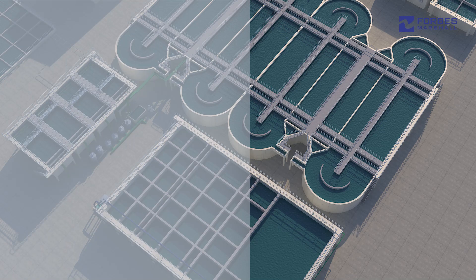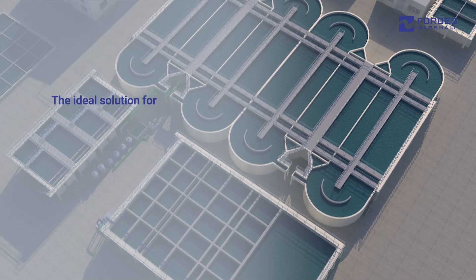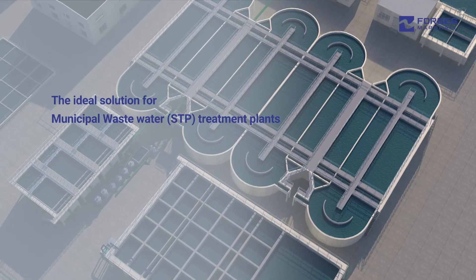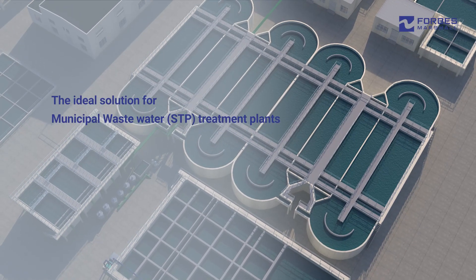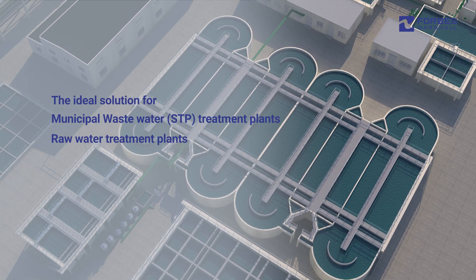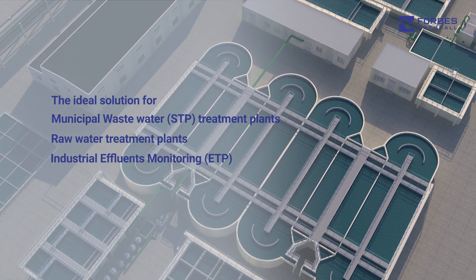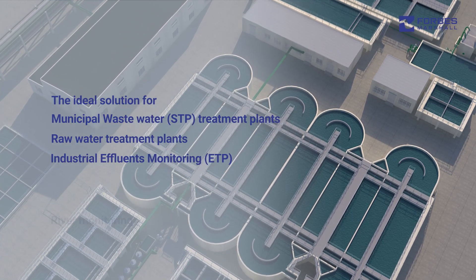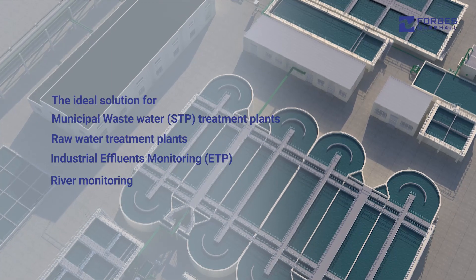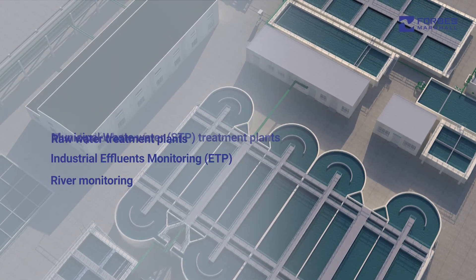It is the ideal solution for applications such as municipal wastewater, raw water treatment plants, industrial effluents monitoring, and river monitoring, with proven performance across sectors.